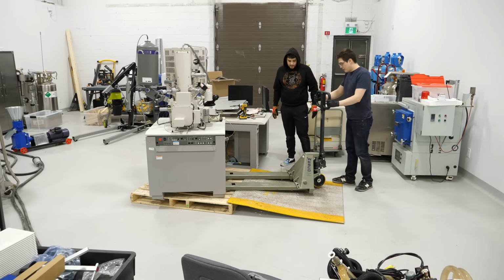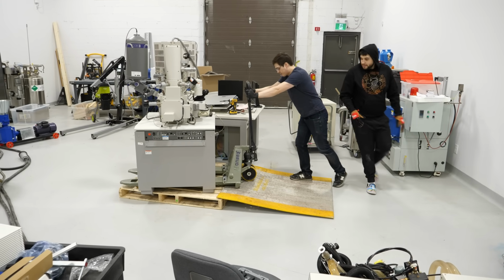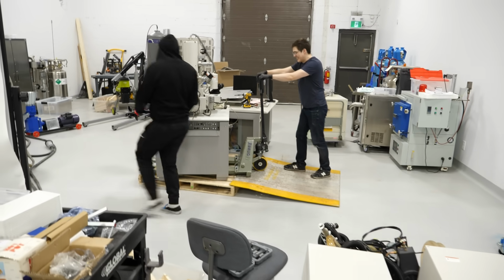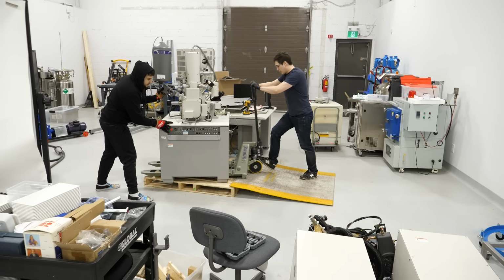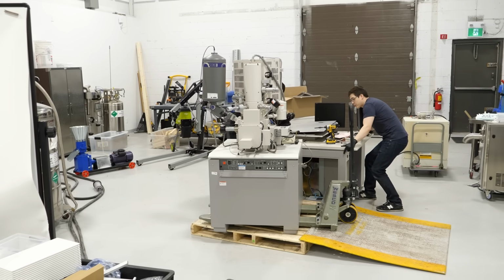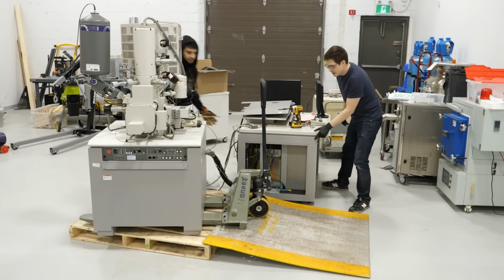So this is the problem too. Straighten it out. Yeah, okay. Now lift it and I'll hold it. I'll just hold it like here. This is such a bad thing. Just to keep it balanced. I'm gonna bottom it. We need to pre-move the table, so like here, to predict the movement of this.